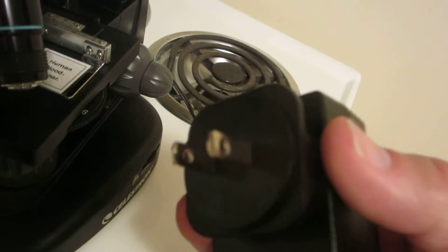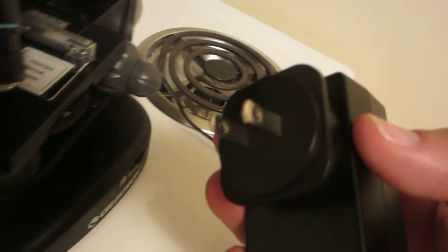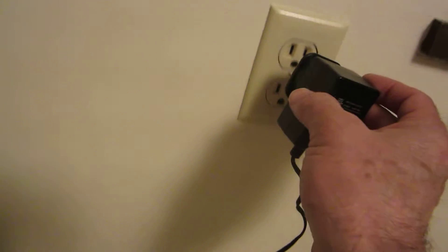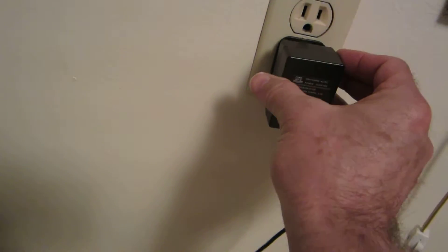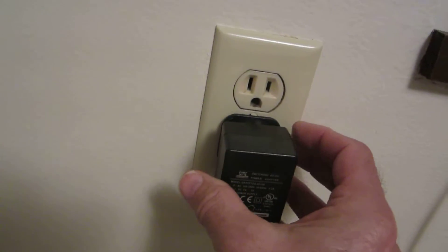Be sure you have the right AC plug. They come with universal plugs for different locations in the world. Now you plug it in, and be sure you have the connector plug there.